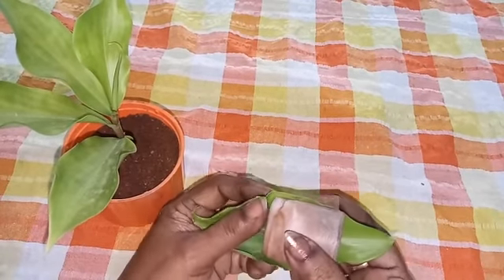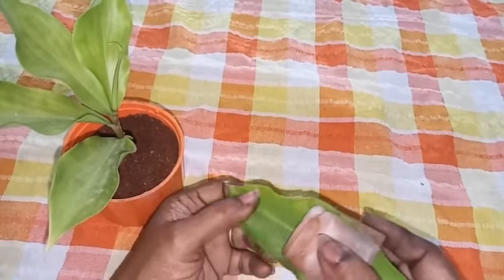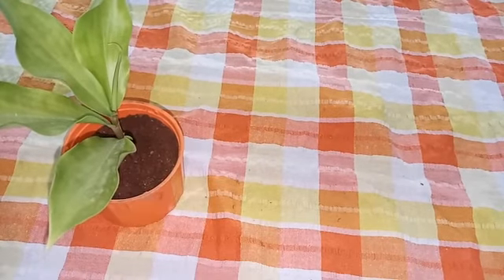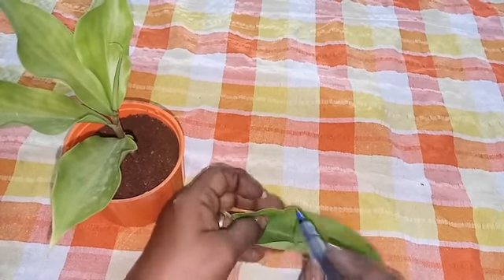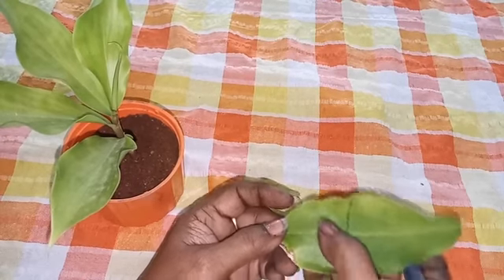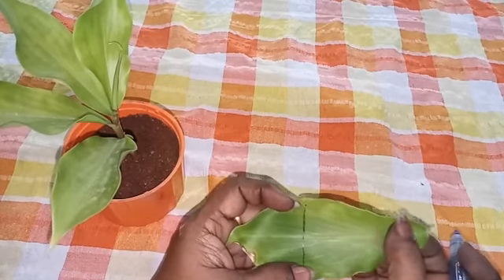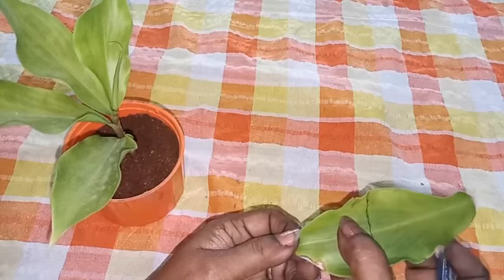After that, take the leaf and do the starch test. This part of the leaf is inside the bottle. So if you do the starch test, the portion of the leaf which is seen inside the bottle alone will not turn blue-black, whereas the remaining portion of the leaf turns blue-black because it is getting everything. Why is this one not turning blue-black? Because it is not getting carbon dioxide.